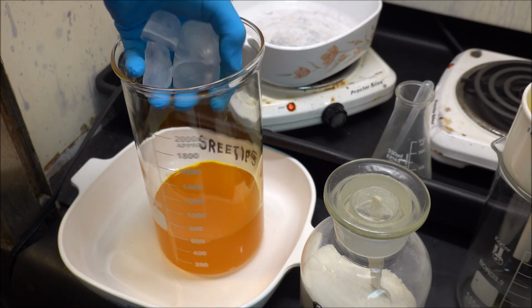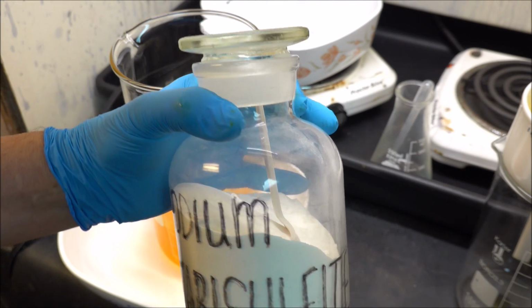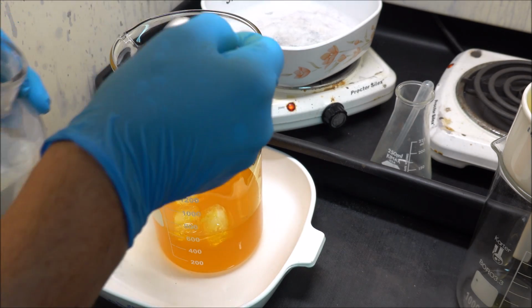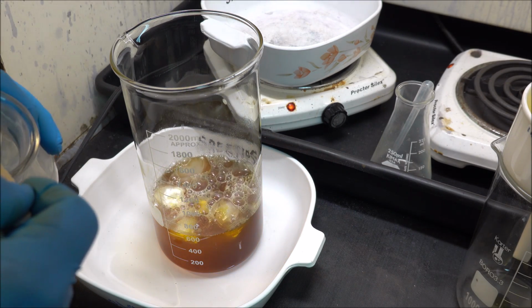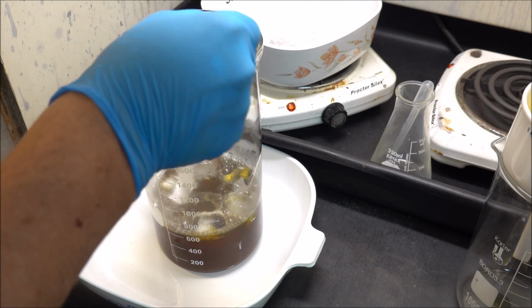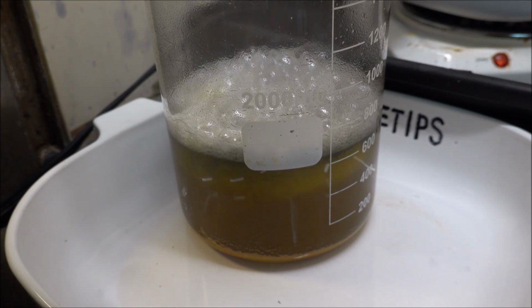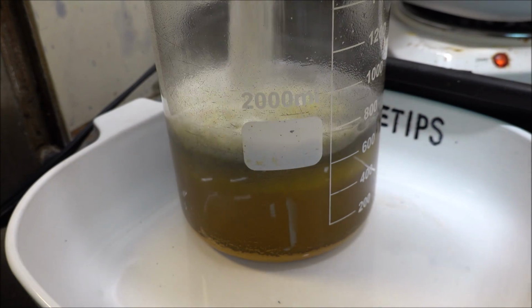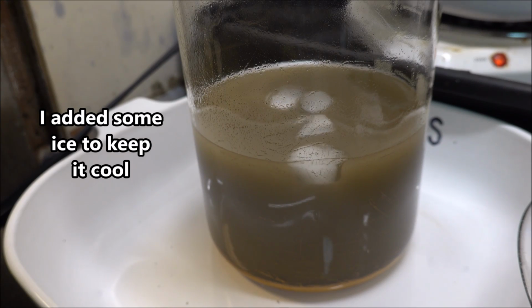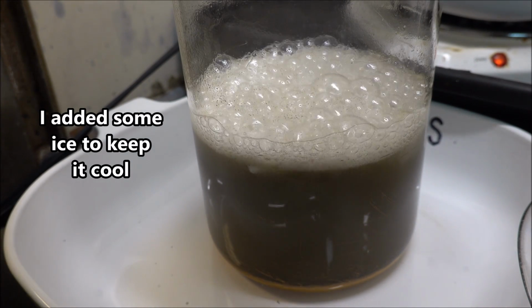I've got about 3 or 3.5 troy ounces of gold in here. Whenever I have that much, I always add some ice. Now we're going to use some sodium metabisulfite and precipitate out the pure gold. Got everything to come out of solution now. Add one more spoon here and see what happens. That's looking like we got everything precipitated.